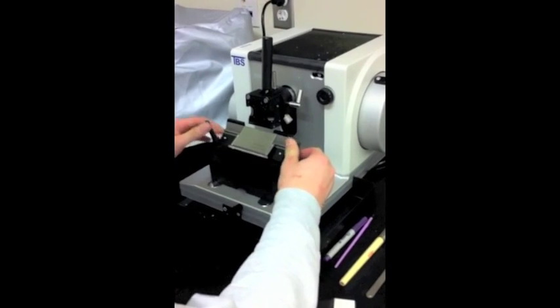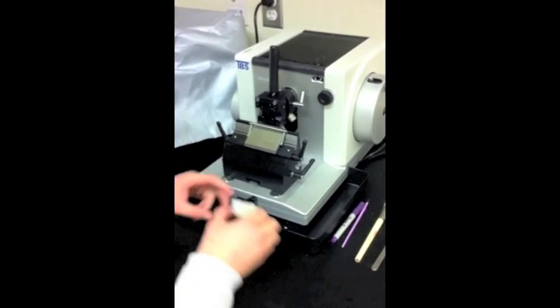If a new blade is not required, make sure the finger guard is down before you start adjusting the stage.